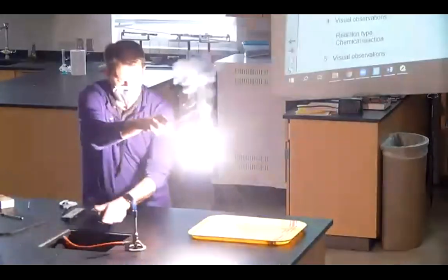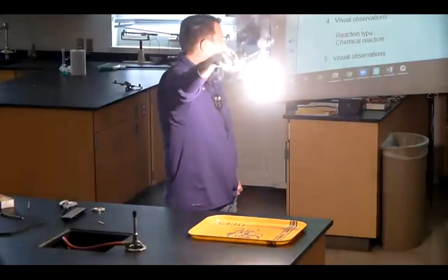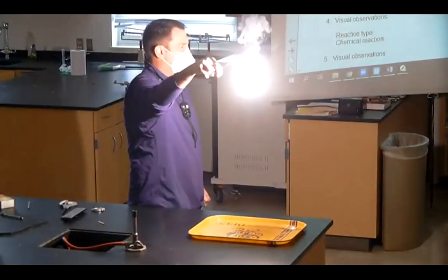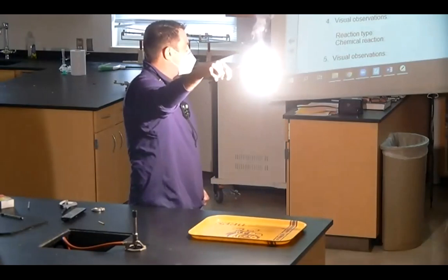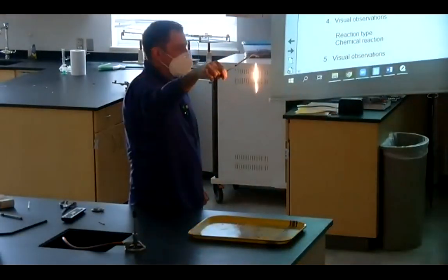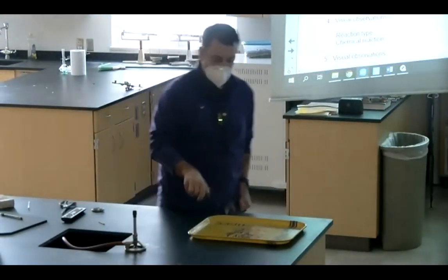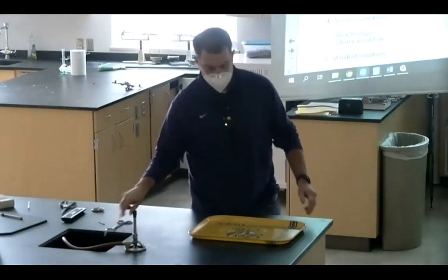Oh gosh, don't stare at it. All right, don't stare at it or you won't see the rest of the lecture today. But you can sense there's some stuff being given off, right? Ooh, how pretty. Okay, when it goes out, come back and look. Oh, it already fell. Gosh dang it, it already fell. All right, I'm just going to put that down there.